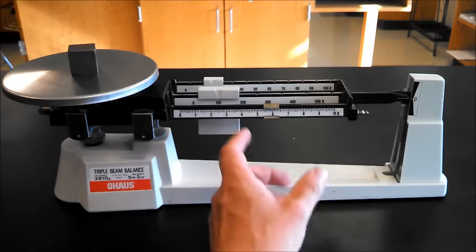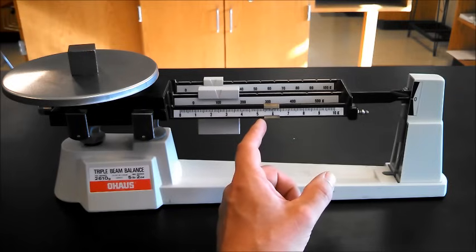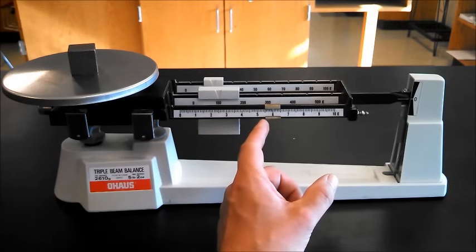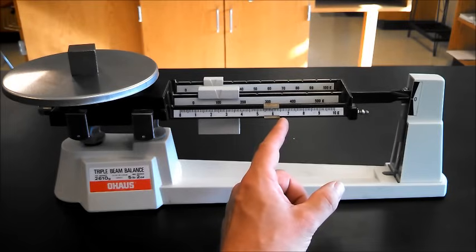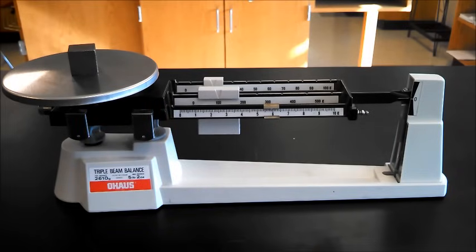That's lined up pretty good. We want to try to be as accurate as we can with the triple beam balance. It can be difficult, but get it onto one of these lines that you see on that front bar.